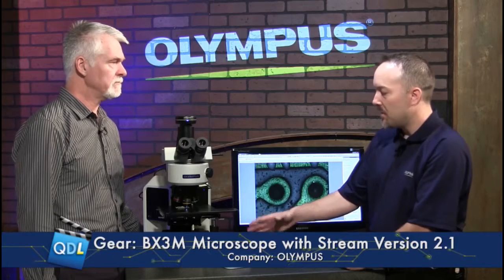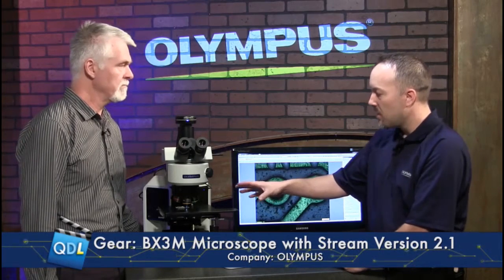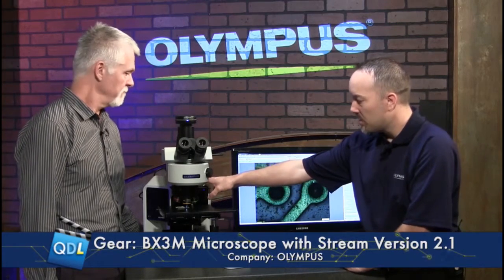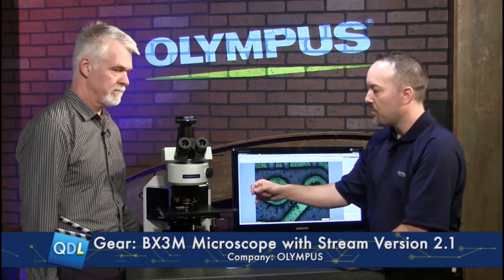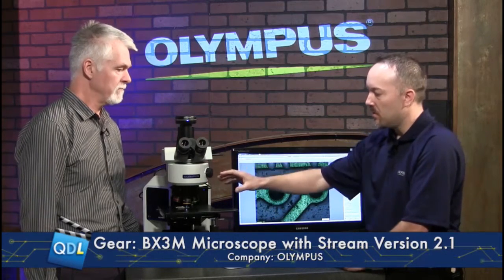This is the BX53M — an upright compound metallurgical microscope. This setup has a manual stage and manual focus, though we can upgrade it to add motorization. The key features of the new design include a smaller frame, a smaller footprint, and a new illuminator and nosepiece with full integration.